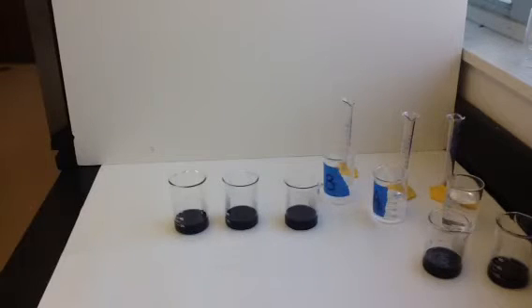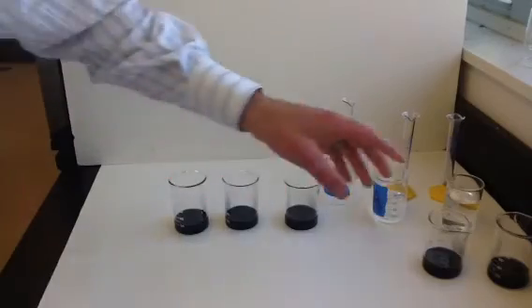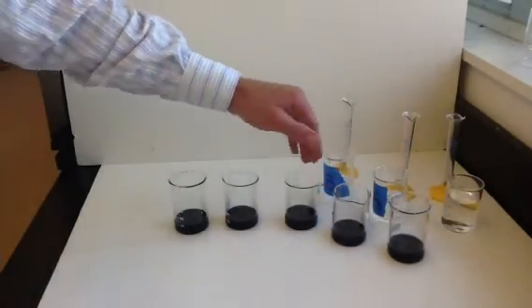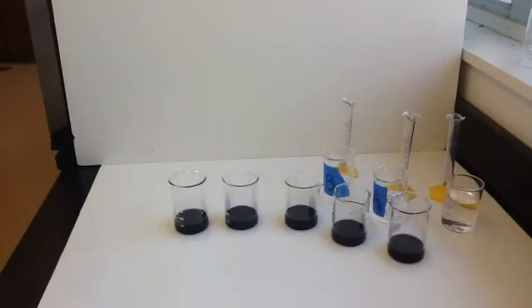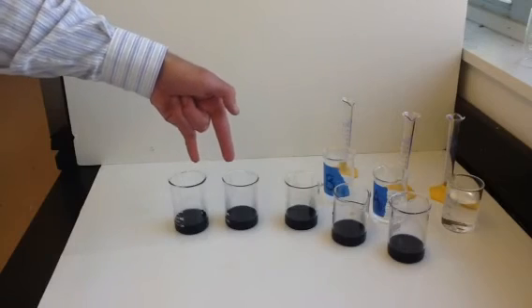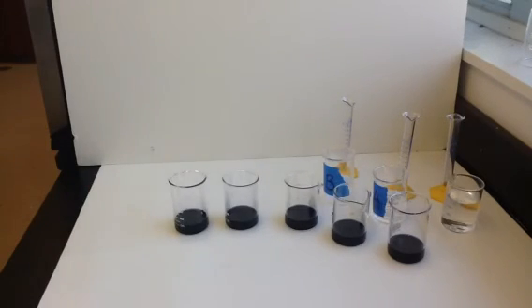All right, our 5th trial, the cold one, has just gone to completion, and you can record how much time that one took. And now you have all the information. You can compare the first 3 trials, which was the highest concentration of A, and then on to lower concentrations of A. You can compare their speeds. And then you can compare the 1st trial and the 4th and 5th trials to look at the effects of temperature.